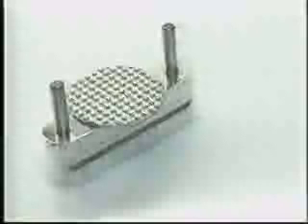The cryoEMBEDDER is adaptable to all makes of cryostats. It's small enough to fit down inside the cryostat chamber. It maintains its freezing temperatures through the conducting of the cryostat chamber into its aluminum composition, not through the use of liquid nitrogen. The precision design assures exact alignment embedding and spares tissue loss. It eliminates crystal artifact through temperature infiltration versus flash freezing.